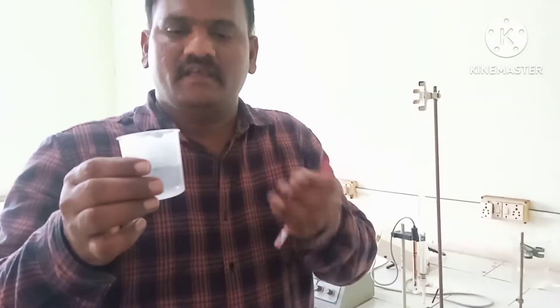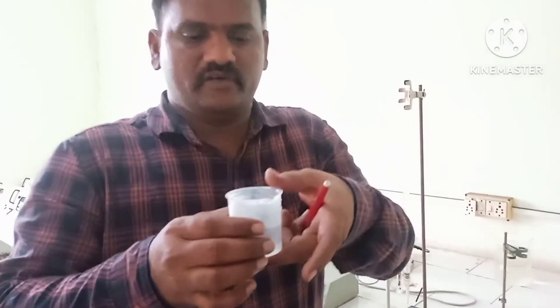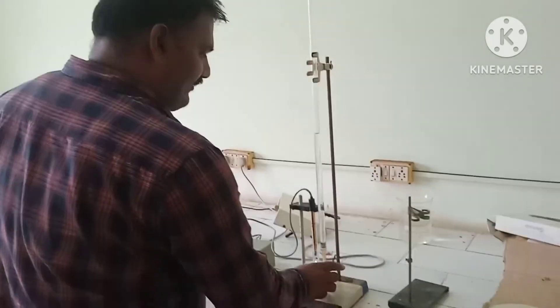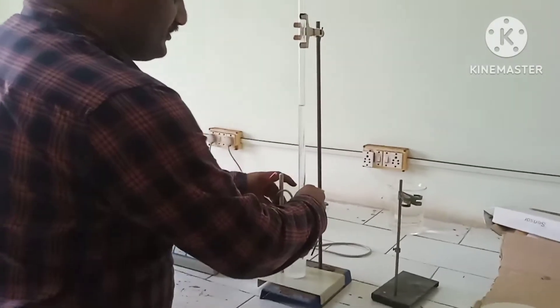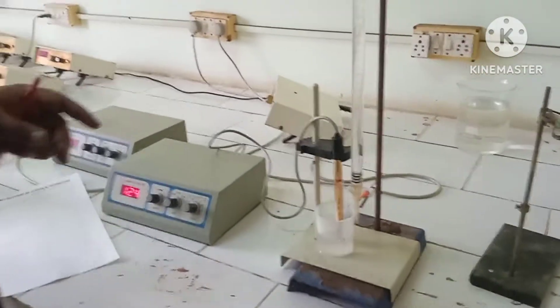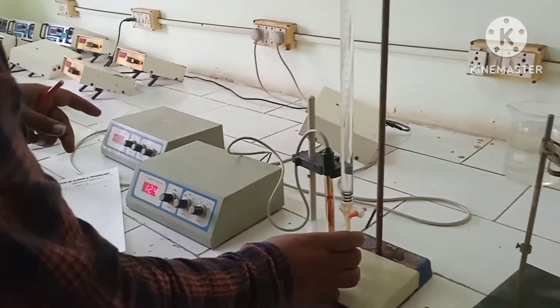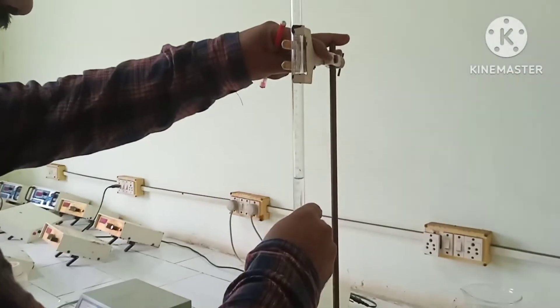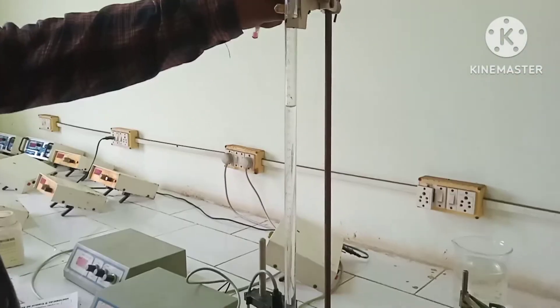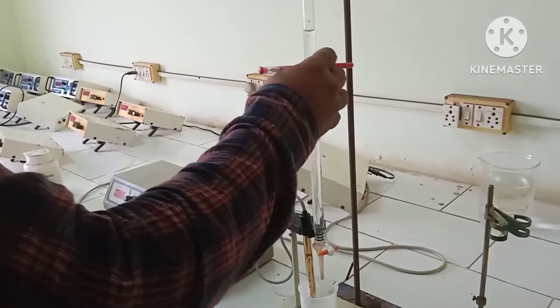The difference is, for example, this is our conductivity electrode. If we add 10 ml HCl, we can add 40 ml water. The conductivity electrode is partially immersed in the solution. We will have the NaOH solution.